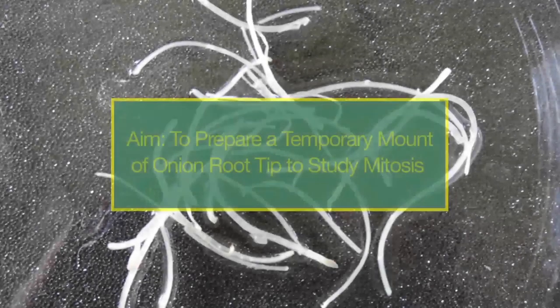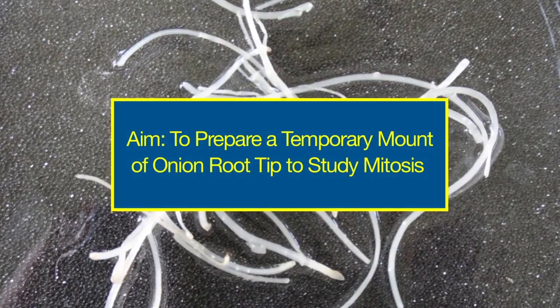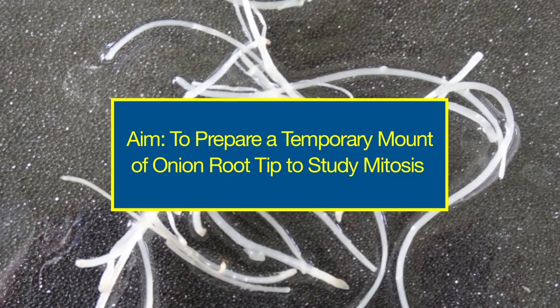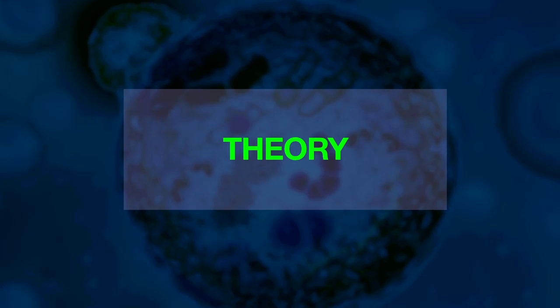Hello students. The topic of today's laboratory module is Study of Mitosis in Onion Root. The aim of the experiment is to prepare a temporary mount of onion root tip to study mitosis. Let us first see the theory.